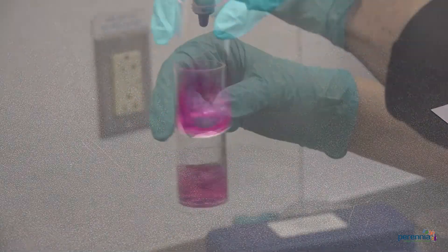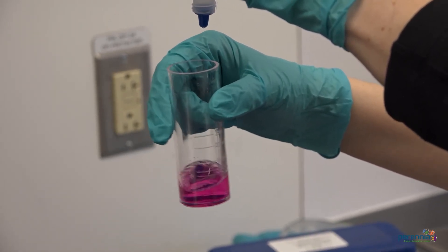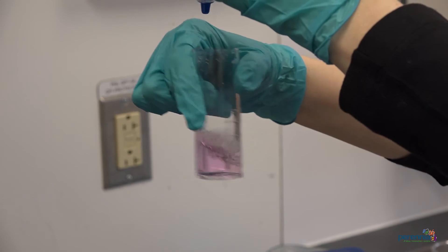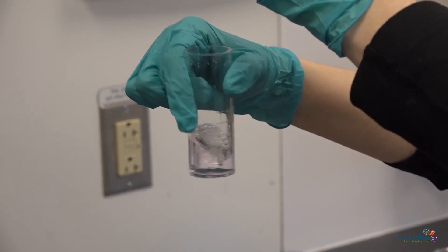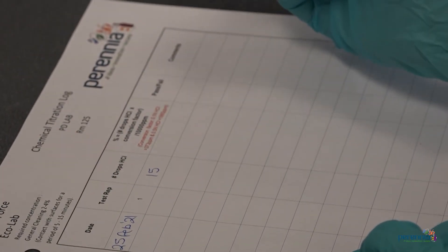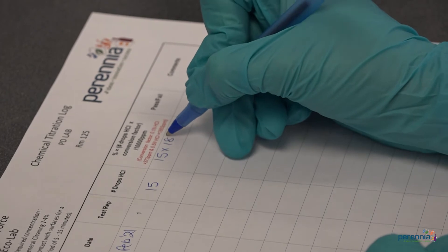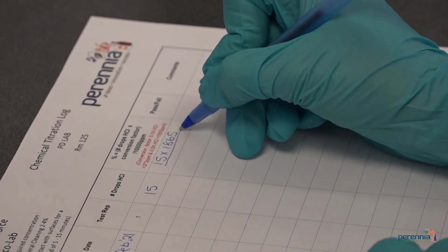Step 5: titrate with 0.5 normal hydrochloric acid number 052, one drop at a time, counting and swirling between drops until the color changes from pink to colorless. Step 6: record the number of drops of number 052 multiplied by 1865 parts per million, which is our multiplication factor. This gives you the concentration in parts per million. Record this on your monitoring record.